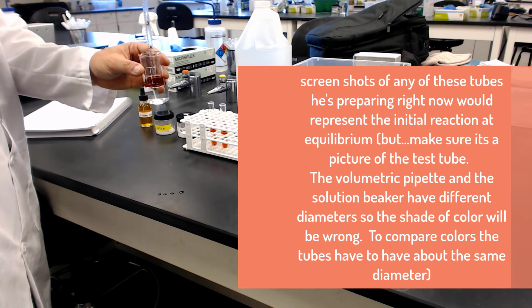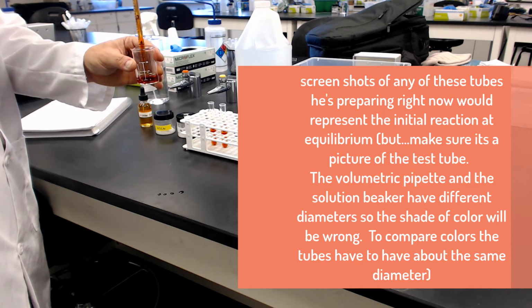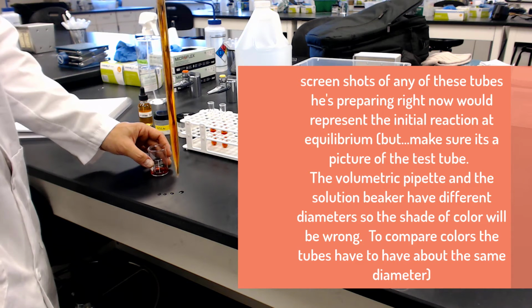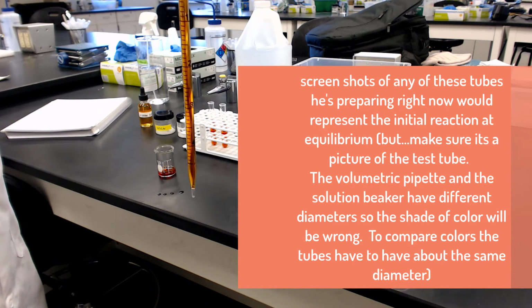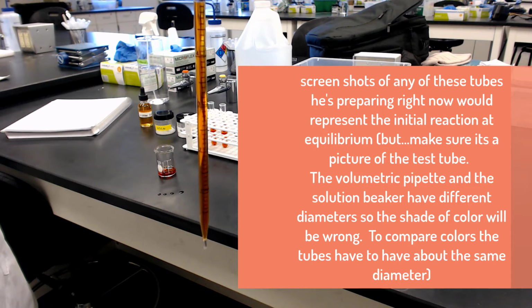Another trick on this is, if it's a little open like this, you could even make a mark on one tube and then just quickly fill the other 4 tubes to the same mark. That'll also get the job done, because once again, it is not as precise as the other measurement. So this is good to see.